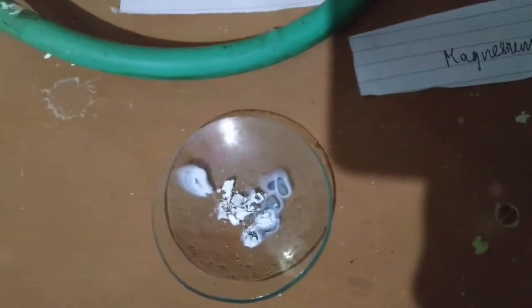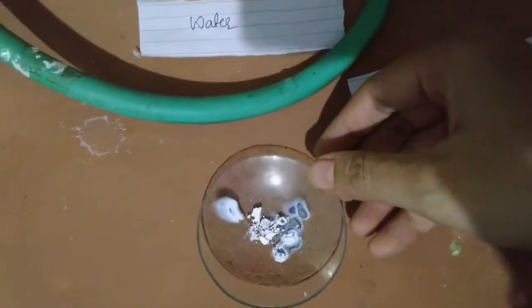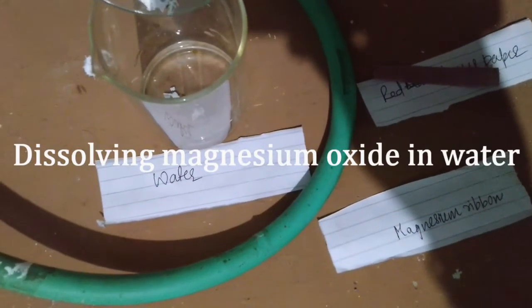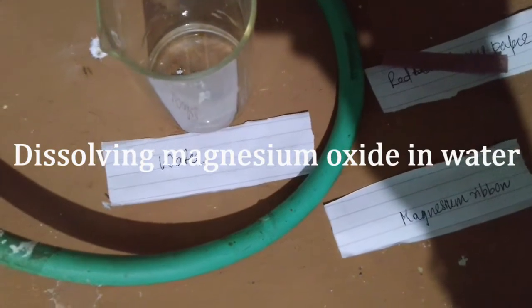Now what is this white colored powder? We all know this is magnesium oxide, right? Now we know this is basic in nature. Now I am going to add a little amount of magnesium oxide to water. We know it will get dissolved. So let's see if it gets dissolved or not.